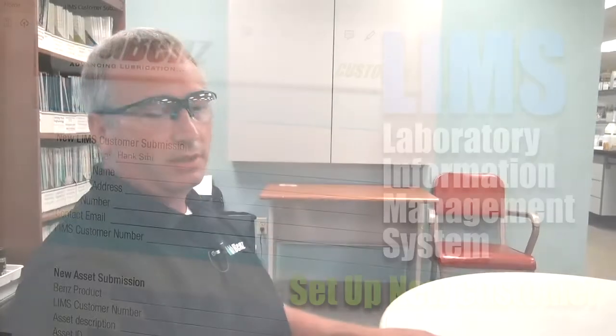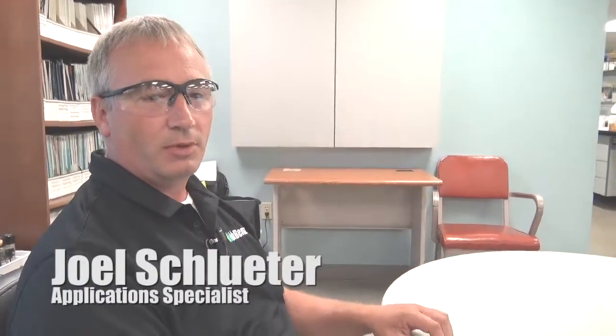What we're going to do today is I'm going to show you how to step through and find the documentation to set up a new customer in our LIMS system, which would be our laboratory information system for setting up new samples to be tested in our laboratory. It is the same way for water-based as it is for oil-based, and we're going to walk through the steps on my computer to show you how to do it.